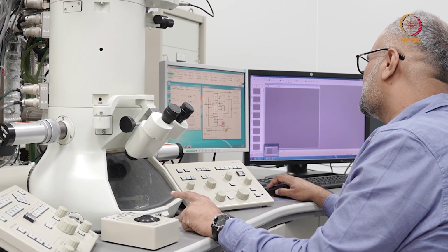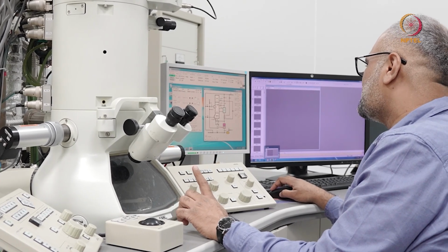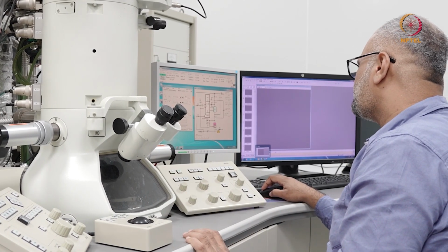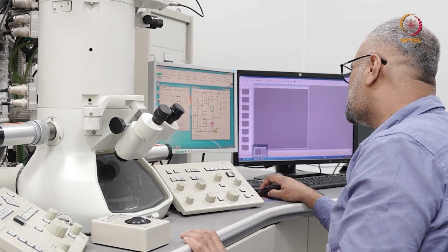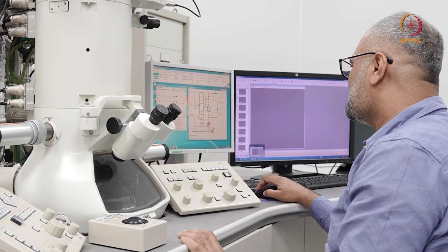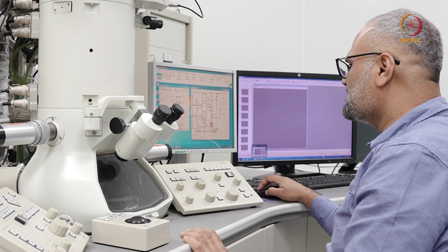Now, once the holder is in and everything is ready, you see the status that evac ready is shown on all these here. Typically, these current values are mostly less than 30 microampere. If it is beyond 30 microampere, then your vacuum levels are slightly high on this instrument. And the RT or the PIG5 value is showing evac ready, so you're not too concerned about this as long as it shows as evac ready. And one of the indications is you see this green light here in this bar, and on the electric console that I spoke about a little while ago, the SIP should be on, showing it in green color.